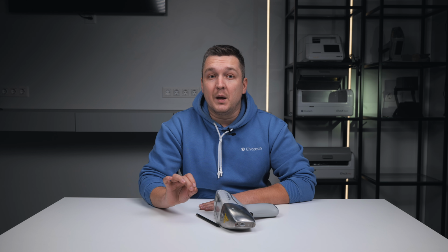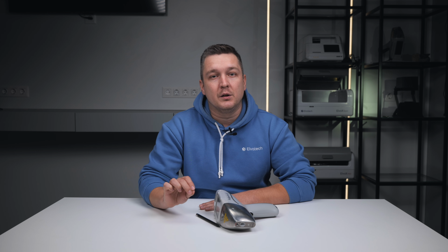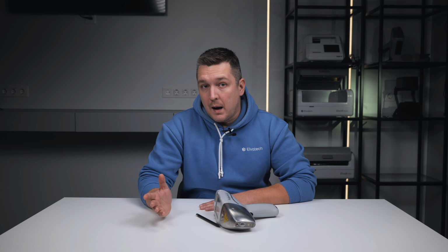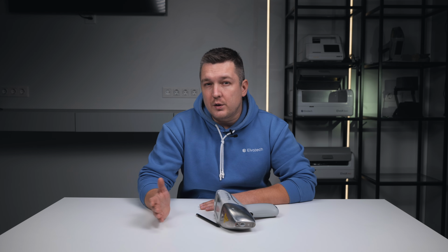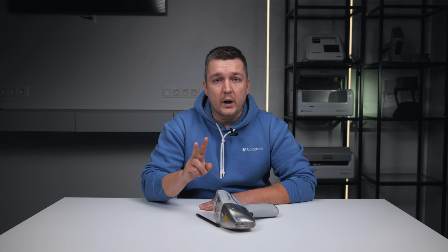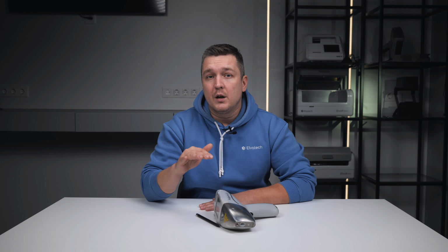And the third one, if the match percentage is low in alloy grade. If in alloy grade you see a low match percentage, it might be an intermediate or non-standard alloy, or a mixed sample, for example a weld between two different steels, or the surface is simply not prepared well enough. In this case, it's better to first improve surface preparation, second look at the numerical values of the elements and, if needed, switch to compare to alloy with the grade you expect.